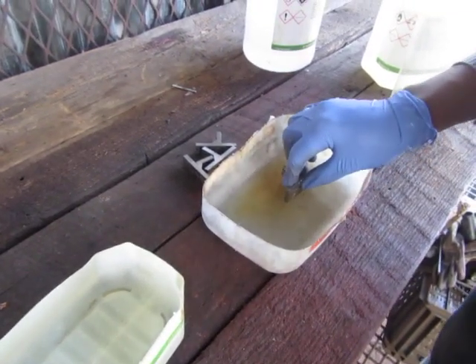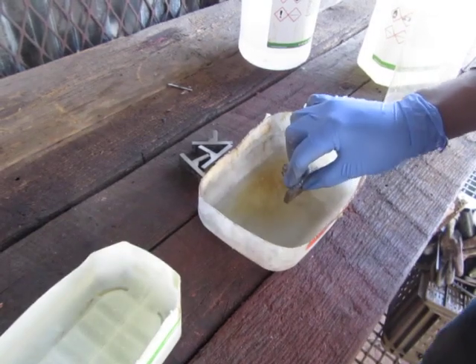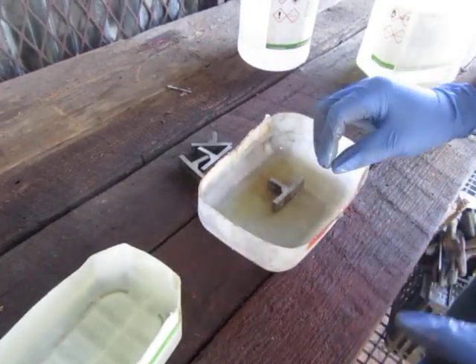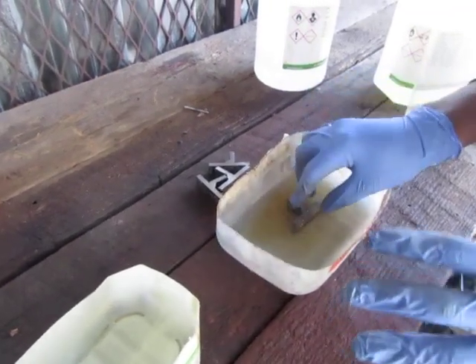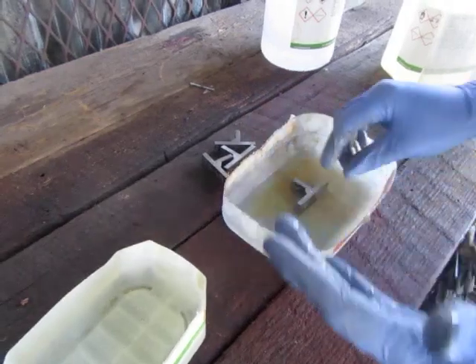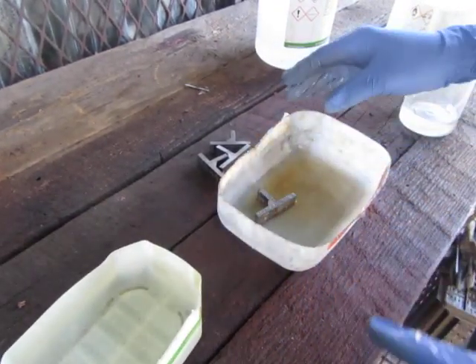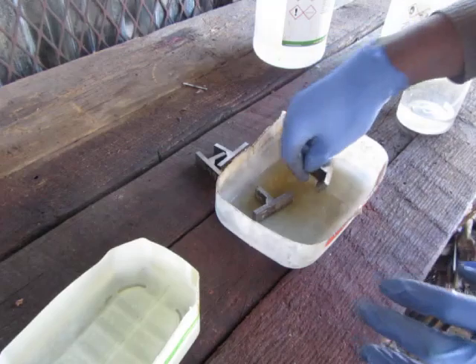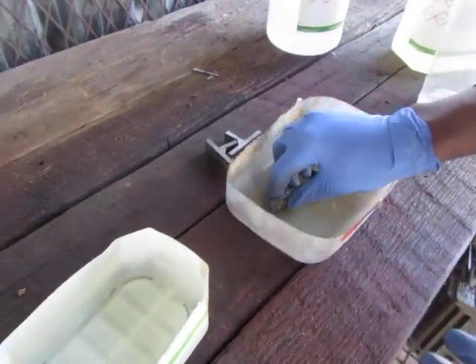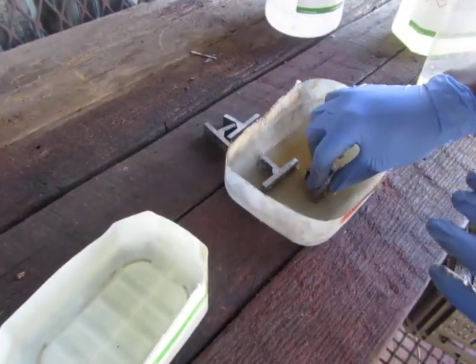The reason why we're doing this, the reason why we're etching it, is because you want to see how the weld looks after we've welded our samples. And then to examine our weld and see if it's acceptable or if we need to do another weld.